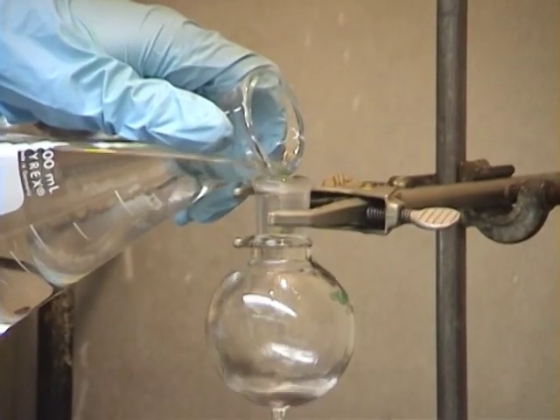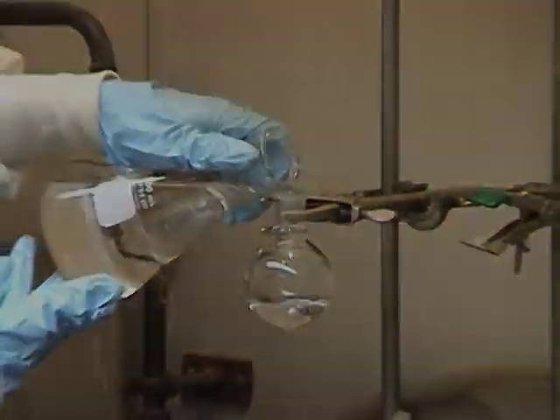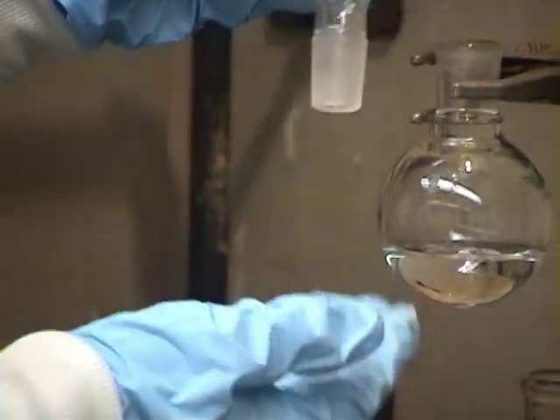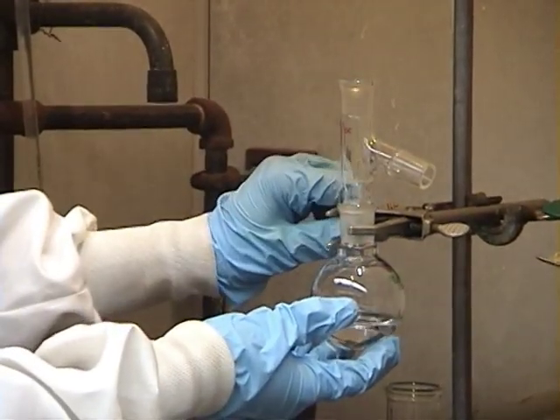The solution to be distilled is added after that. Once the solution has been added, a three-way adapter is attached to the round bottom flask.